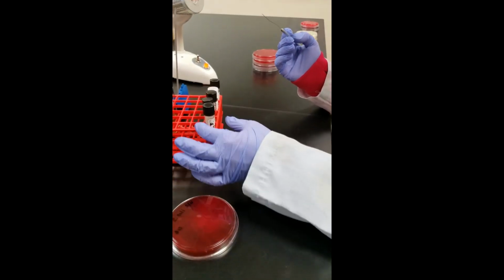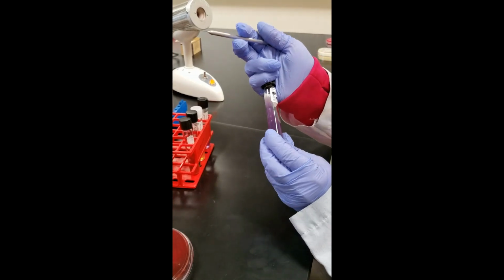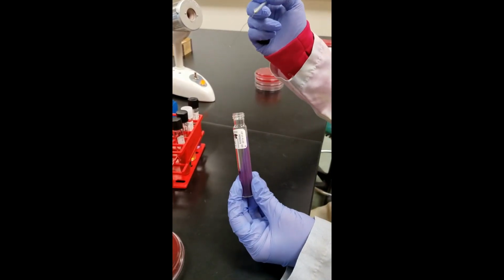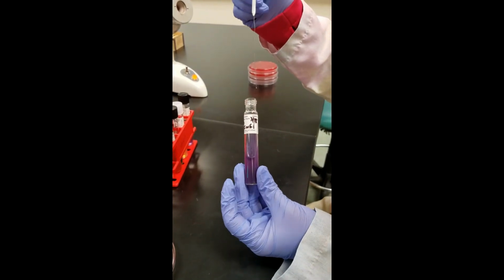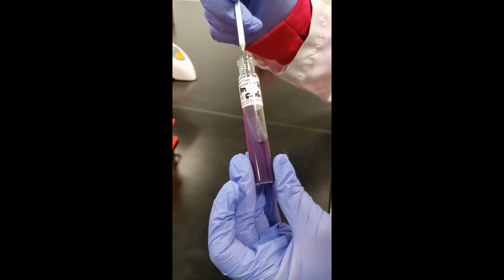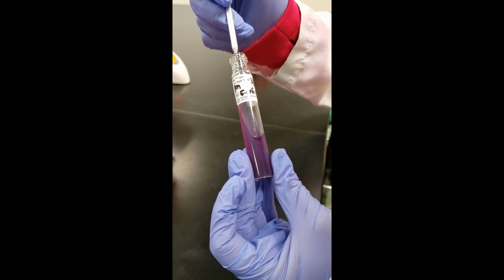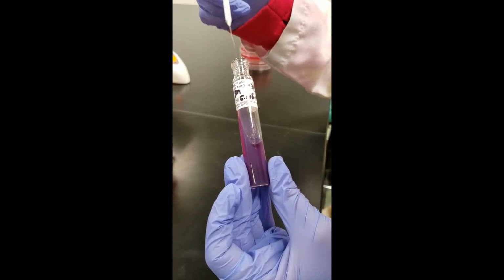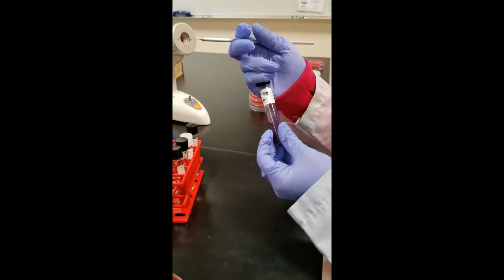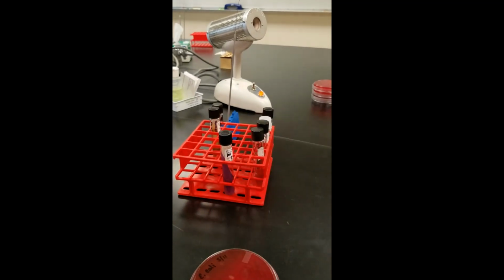And the first tube I'm going to inoculate is the Lysine iron agar. It's going to start off as a purple color. This one, they want you to have a good amount of organism. I can see it on my needle. We're going to stab to the bottom twice. I'm going to stab all the way down, lift it up, stab all the way down in another location, and then I'm still going to zigzag on the slant, still getting some bacteria. This one also seems to work best if it has a tight cap. All of the other ones get a loose cap.